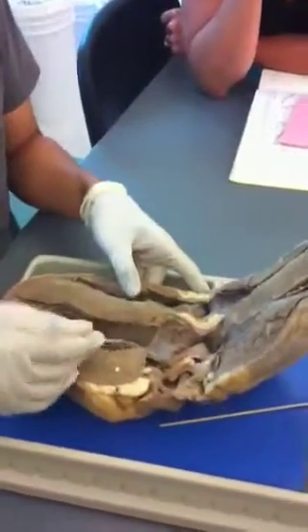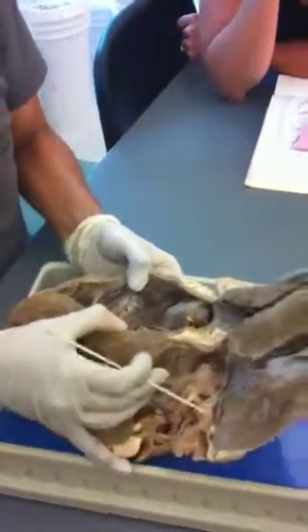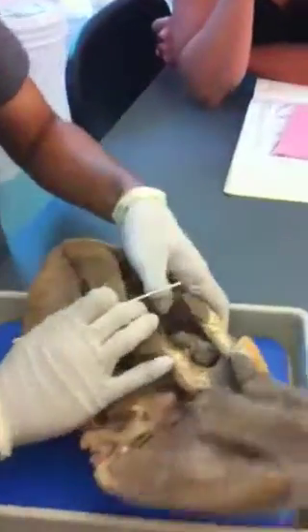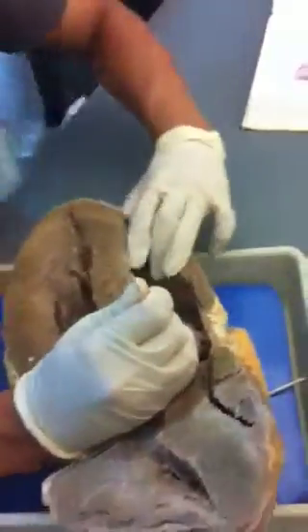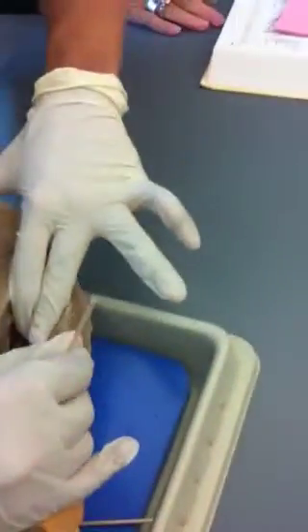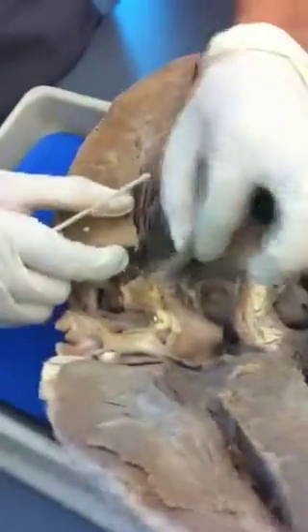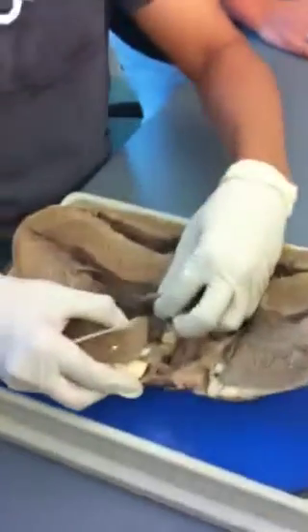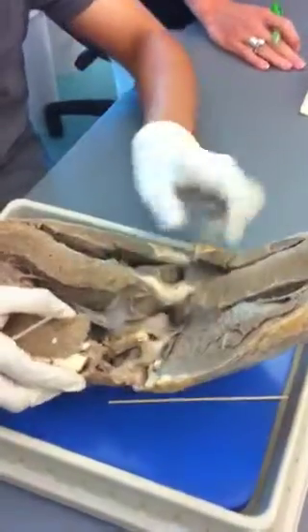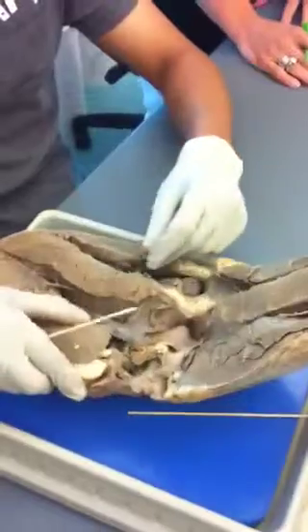So now you've got the ventricles, the chordae tendineae, papillary muscle, and the trabeculae carneae. So these are the other valves — this structure right here. This is the valve. Since this is the left-hand side, what valve would this be? Bicuspid — right, bicuspid and mitral. And since this is the right-hand side, it would be the tricuspid.